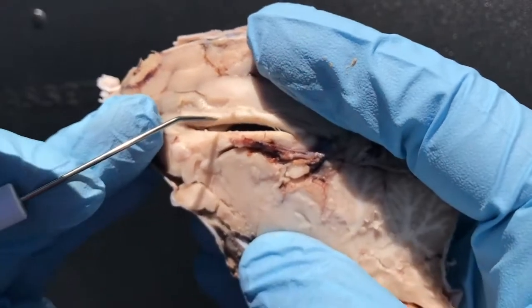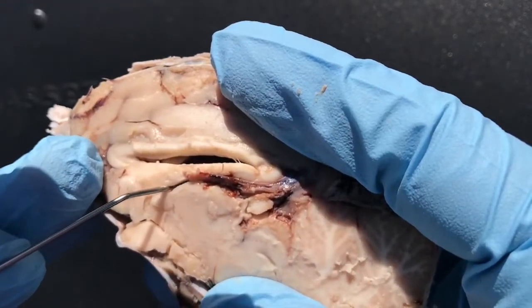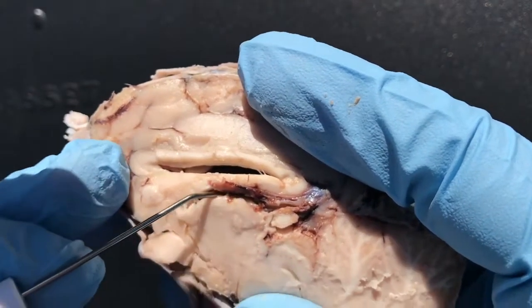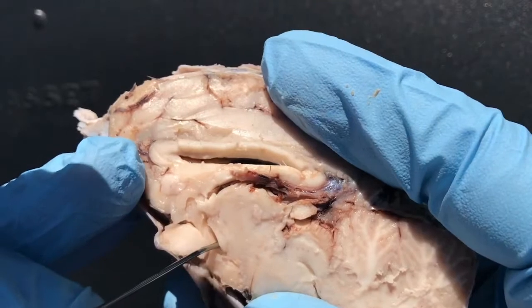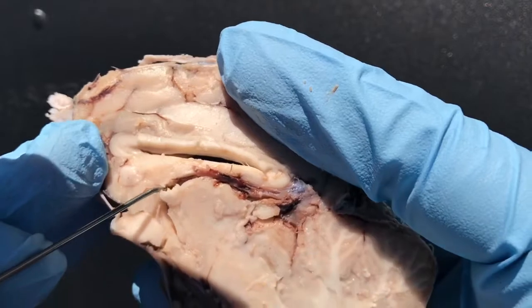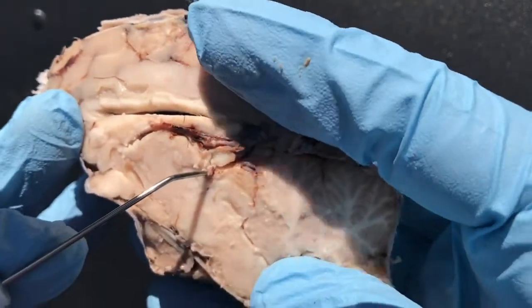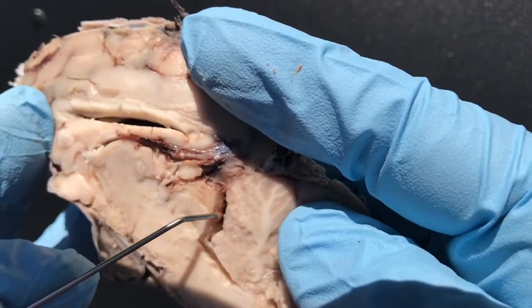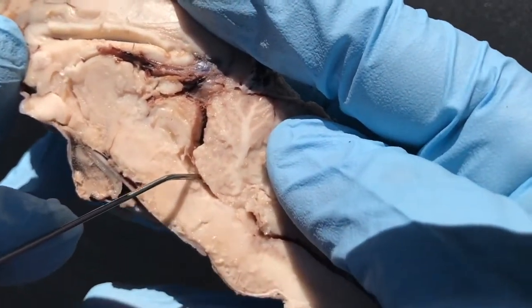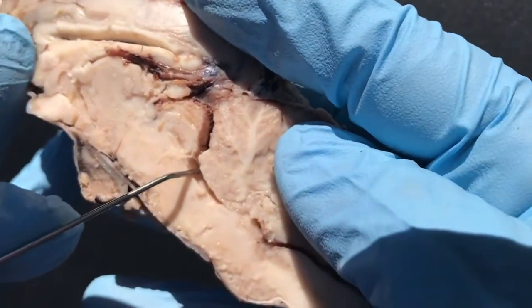And your two lateral ventricles are here. Then your third ventricle — my probe is now inside of the third ventricle. And you can follow the ventricle. If you go posteriorly, you can follow it down like this — down the cerebral aqueduct.